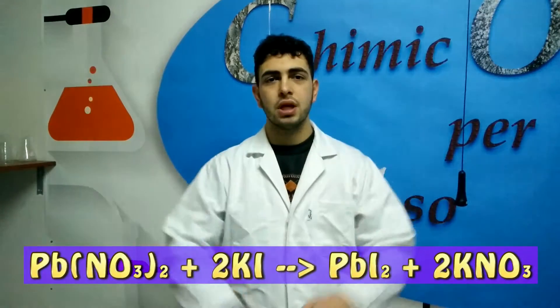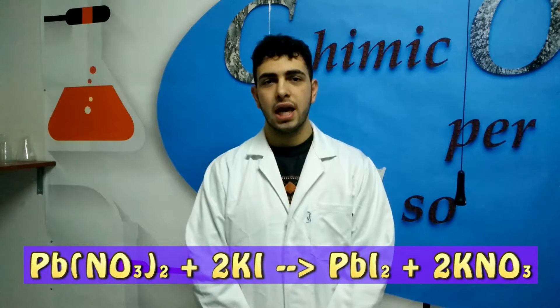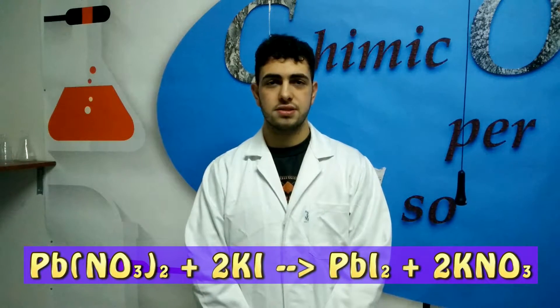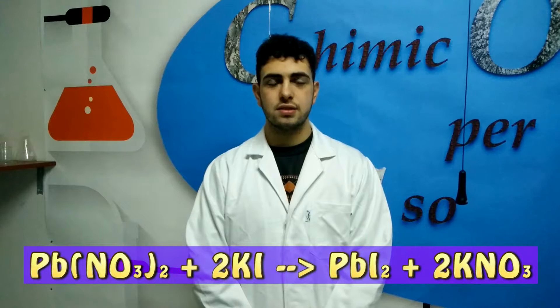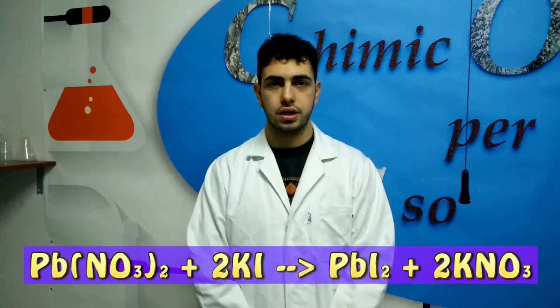So, let's see what happens in this experiment. In particular, in the reaction that you can see below, an important salt is produced. This salt is lead iodide and it is insoluble in water. This is why we see a yellow color forming in our recipient.